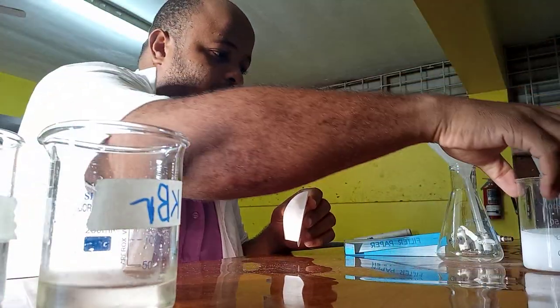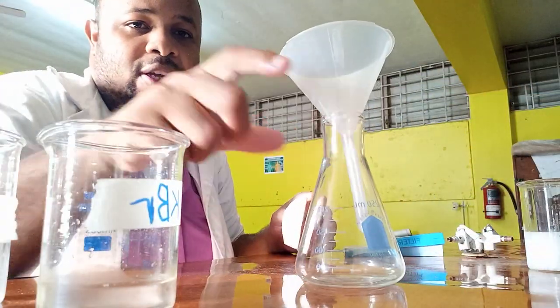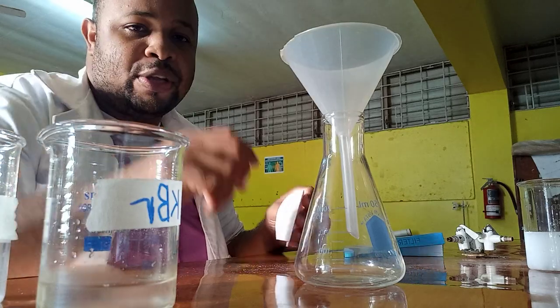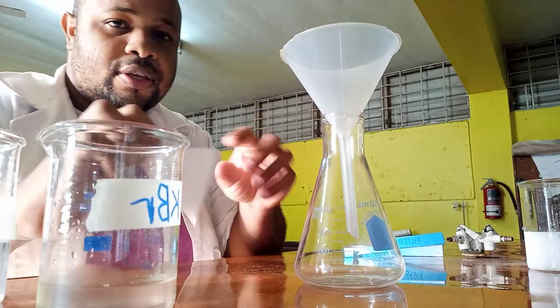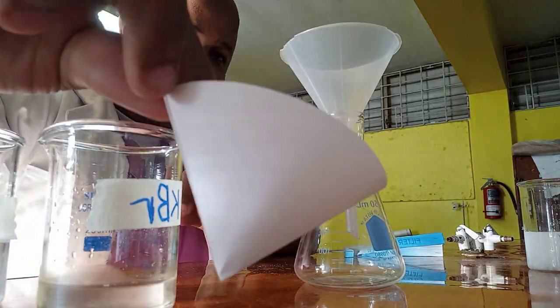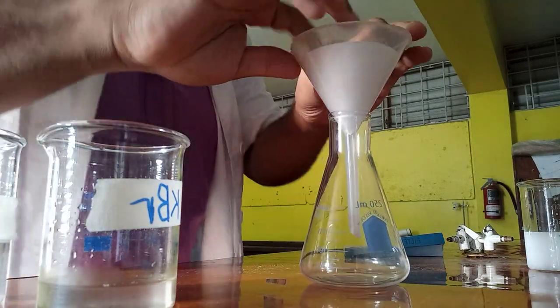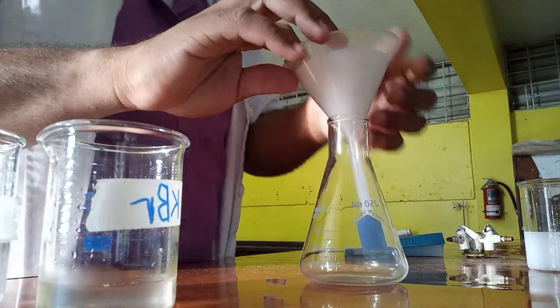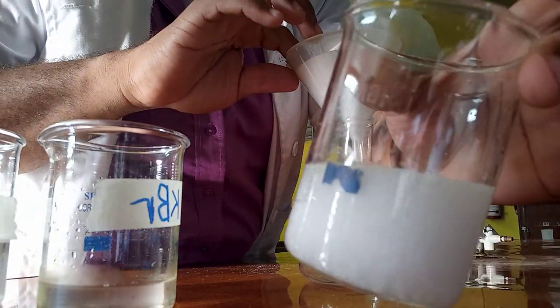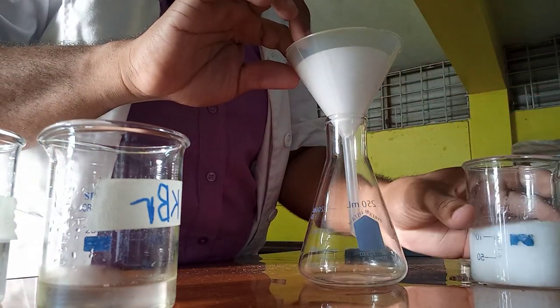I have my conical flask with the filter funnel, and I have folded my filter paper and placed it inside. Now I'm going to pour in the mixture.